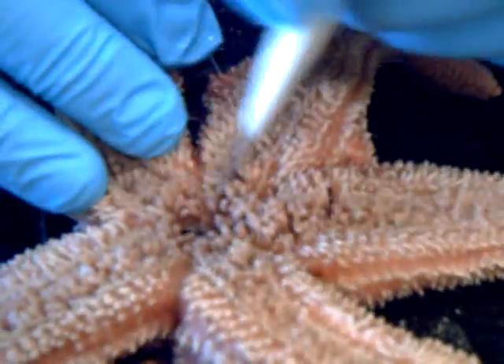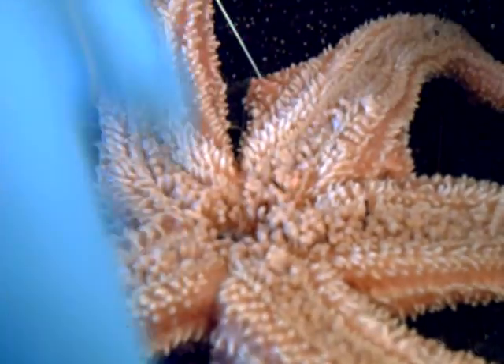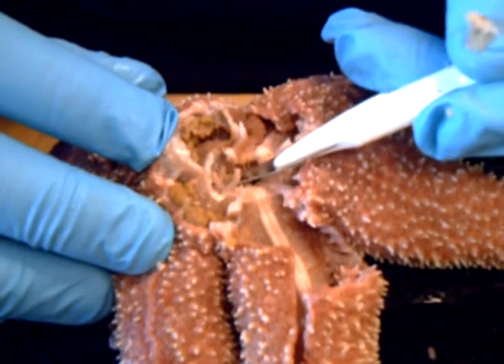Here's a section of the mouth. If you can see this, these are the oral spines right here. And if we flip this puppy over, you can see the vast network of coolness. See, these are the oral spines — these things.